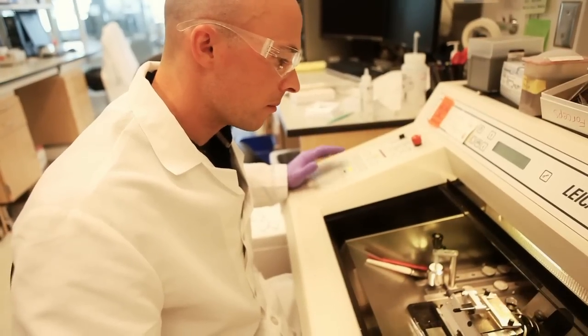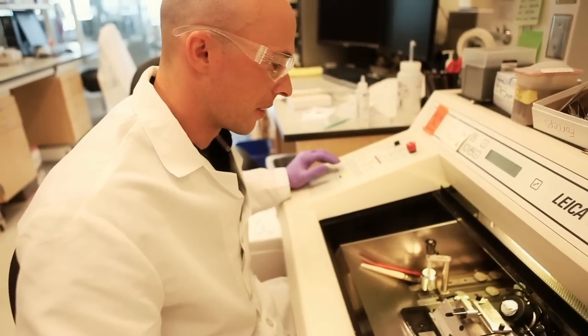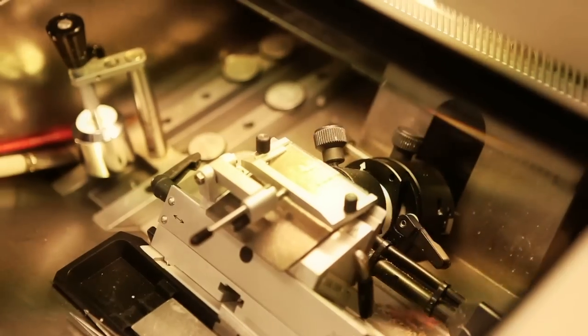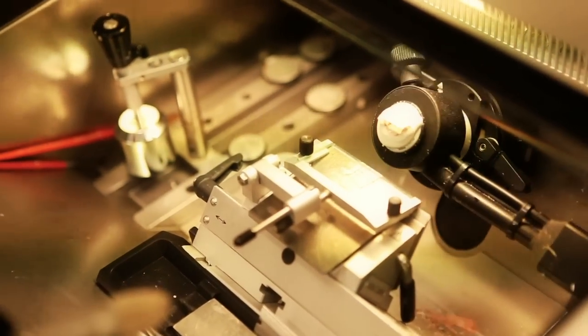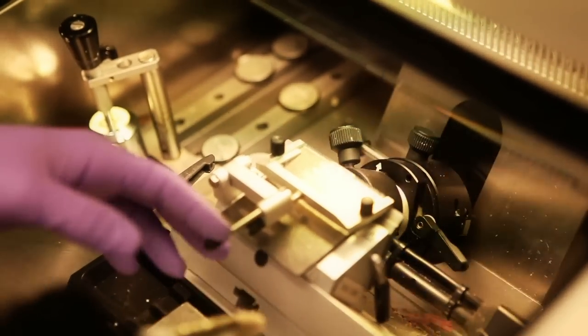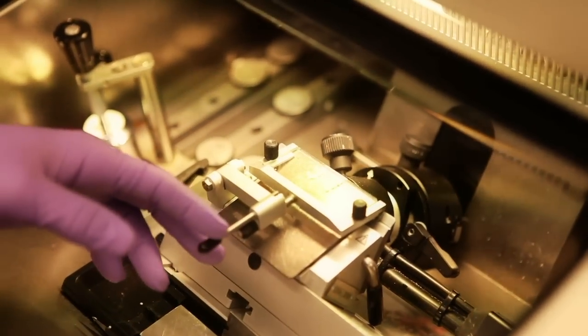Clint's role today is to create microscope slides that will allow researchers to look at the tissue's makeup. Clint begins by slicing the tissue samples into thin slivers.